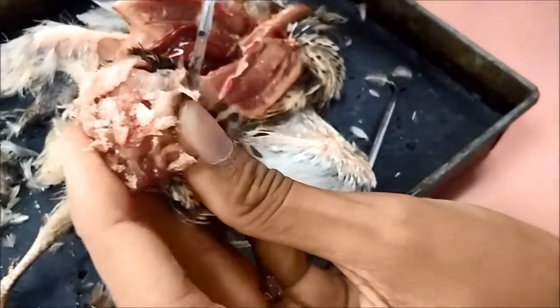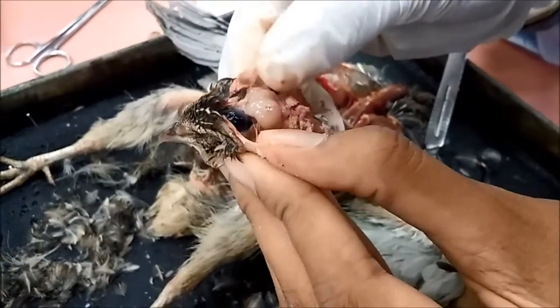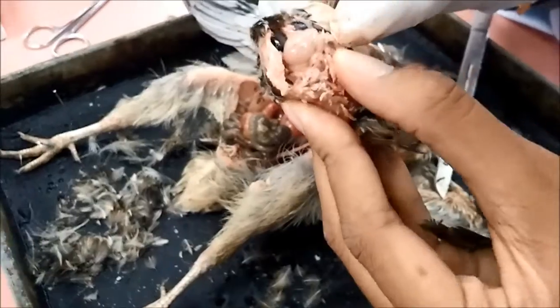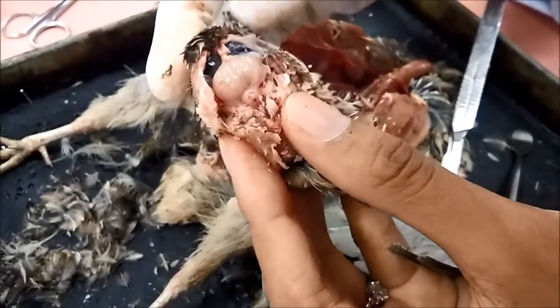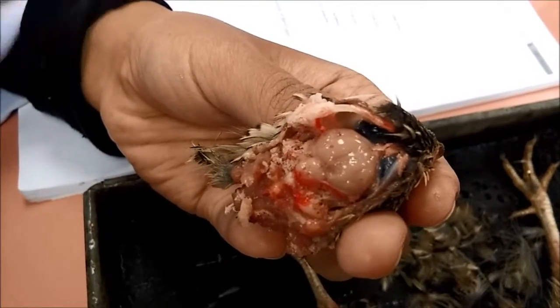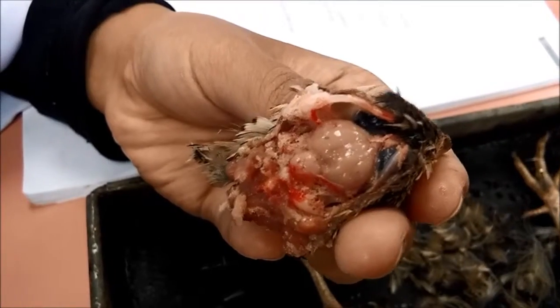This is the general structure of the brain of birds. If you can see here, this big size is the cerebral. Yeah, we can see the brain of the bird there. The cerebral hemisphere, you have the optic lobe, and this one is the cerebellum. And this part under. Alright, so the last part of the bird dissection, the bird anatomy, is the nervous system.